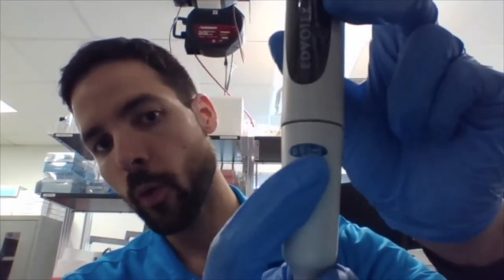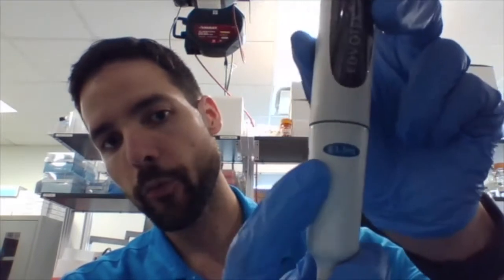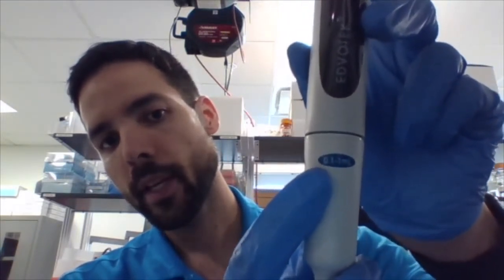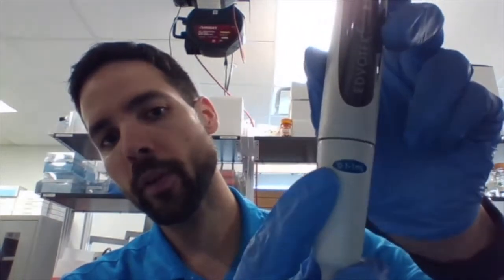So how do I know that I'm using the right micropipette? These come in different volumes or ranges, and they are used for different volumes of sample. We have a P1000, and P1000 because we refer to the micropipette by the maximum amount that it can pick up. So a P1000 can pick up to 1000 microliters, and you can actually see it here. 1 milliliter, which equals 1000 microliters. So from 0.1 milliliters, which is the same as 100 microliters, to 1000 microliters.